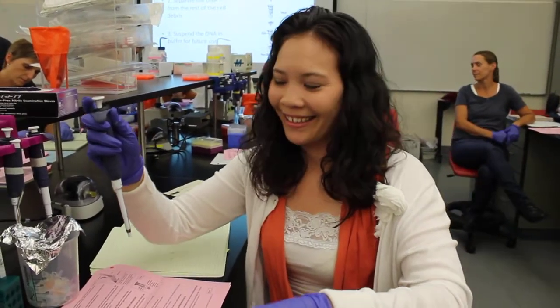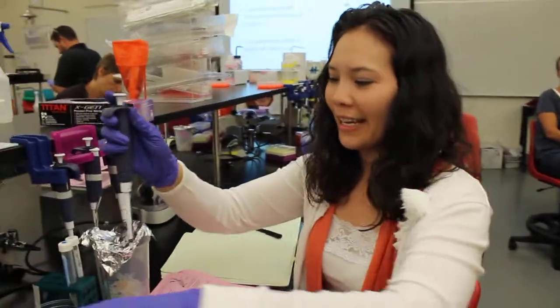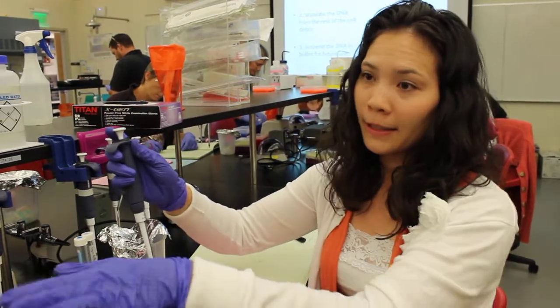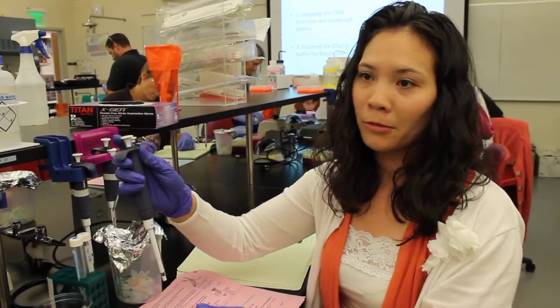Hi, tell us what you're doing and what you think about the program. I'm going to add lysis buffer to my sample. We're going to spin it first and then I'm going to add the lysis buffer to it.